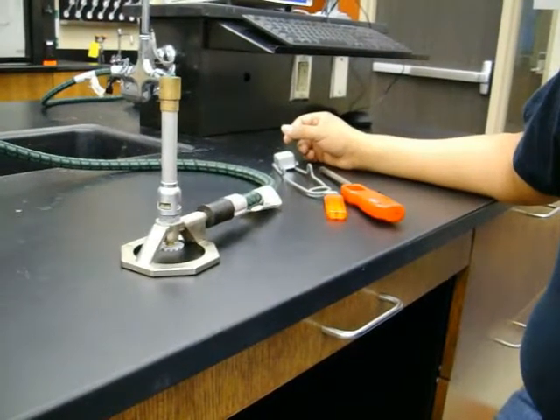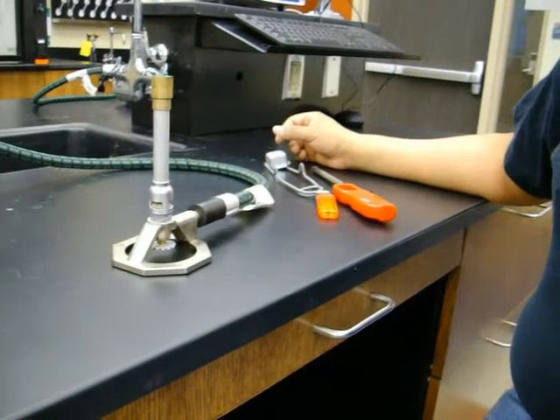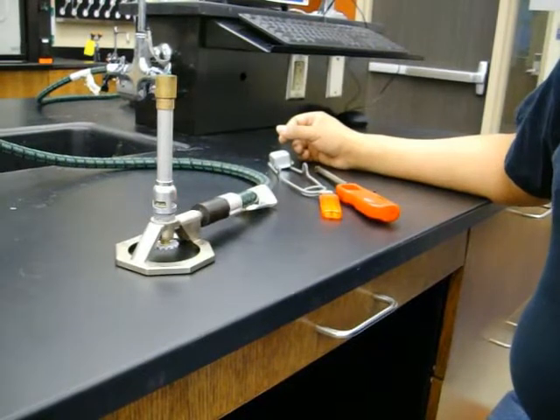This is a video that shows how to use a Bunsen burner. A typical Bunsen burner has the following parts.